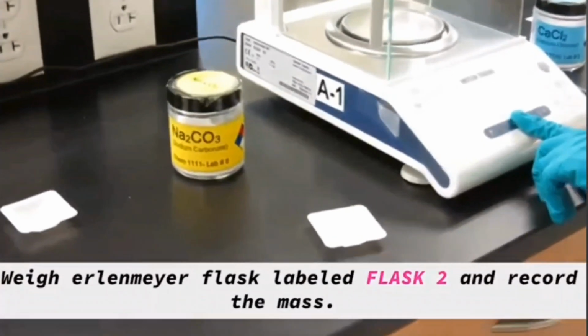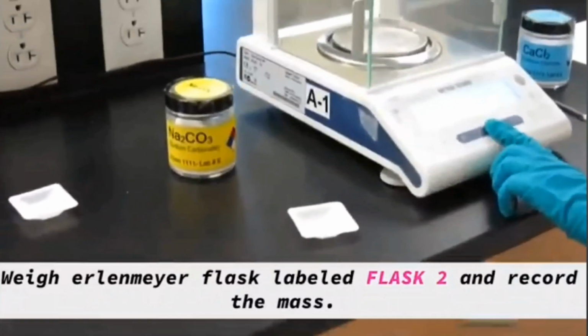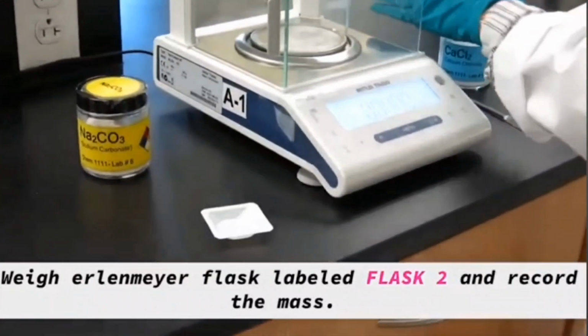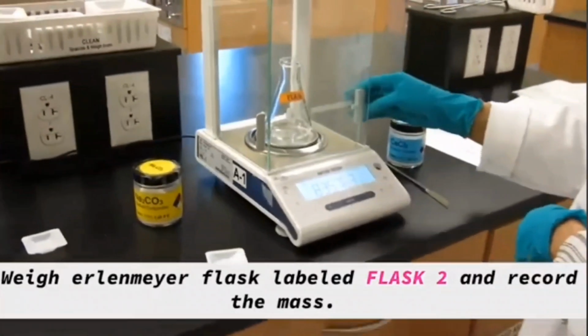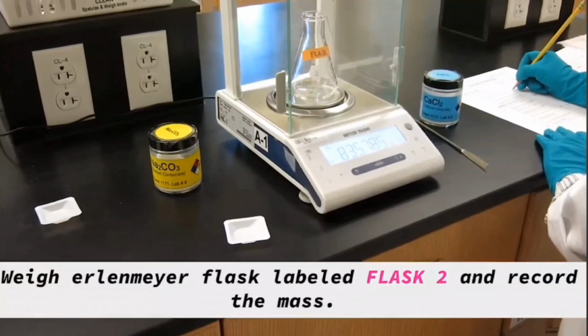And then the next reactant is going to be our sodium carbonate. So we need another flask, which is going to be your flask 2. Tare the balance, and then get the mass of the flask 2 and record the mass.